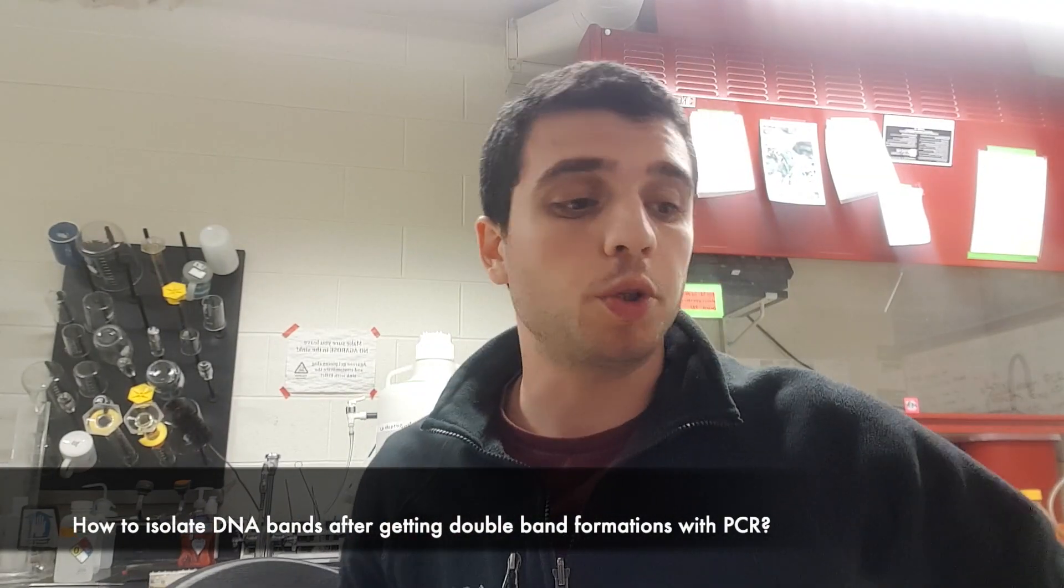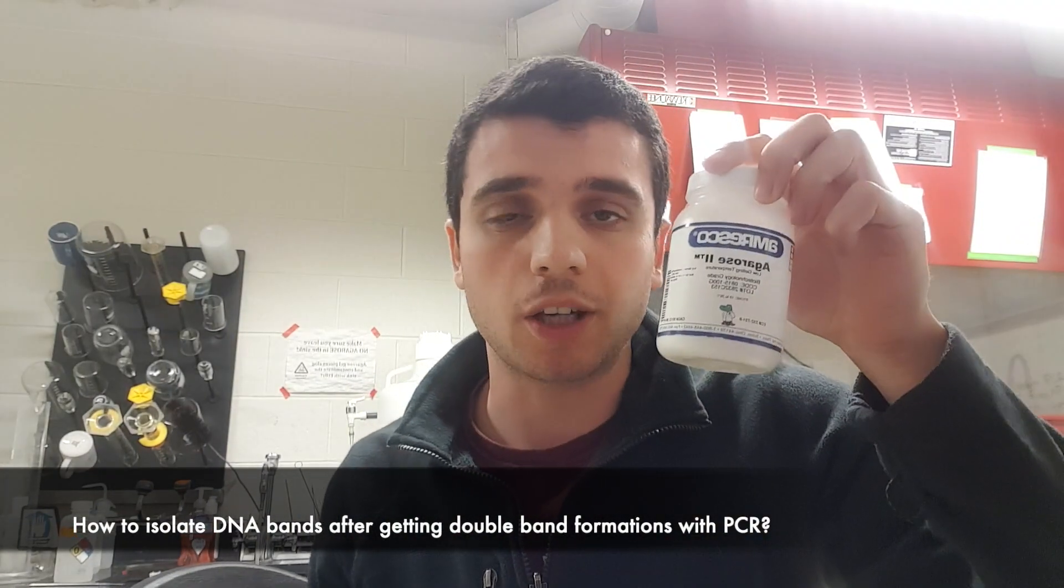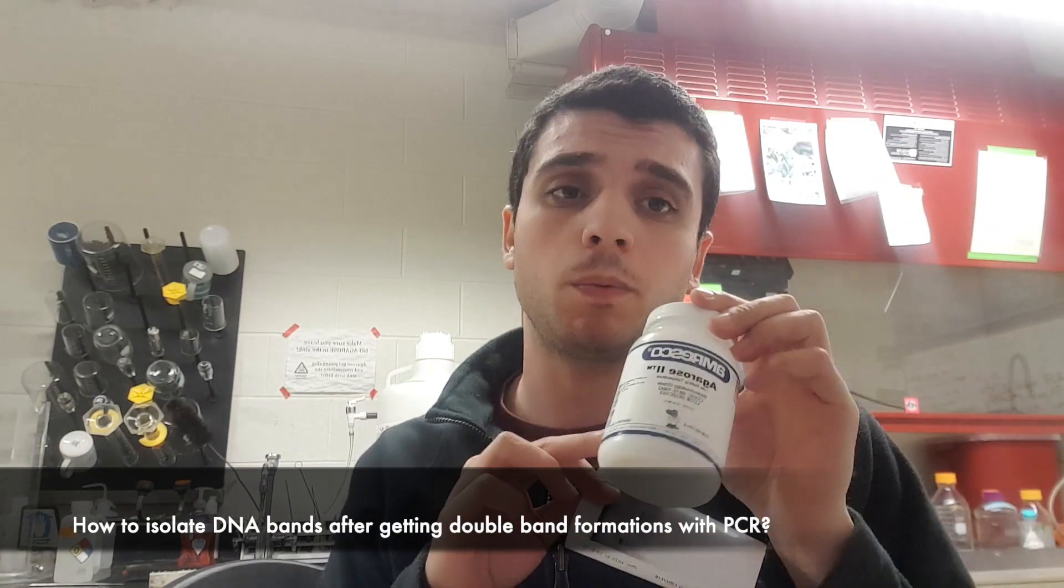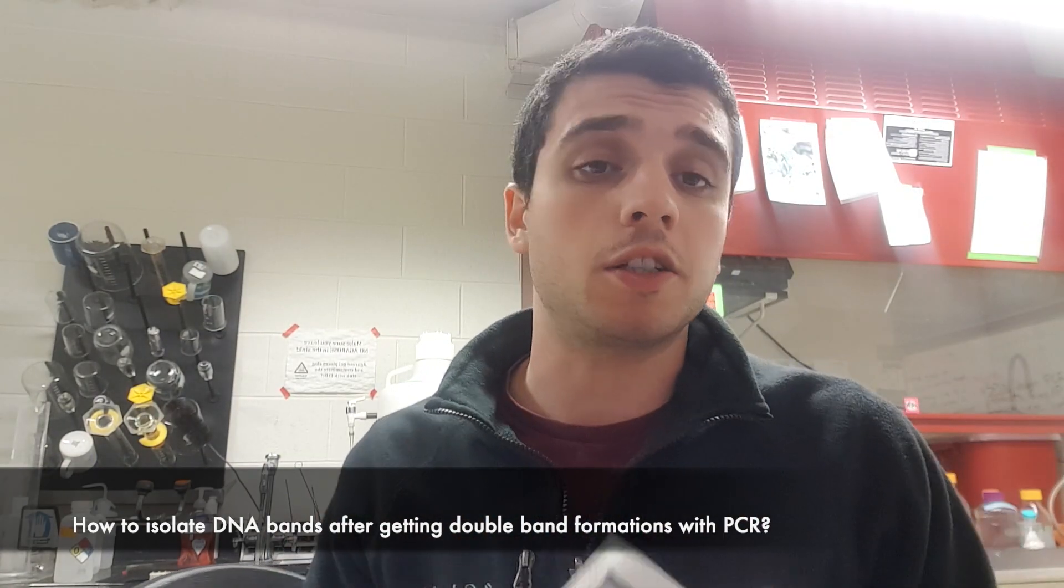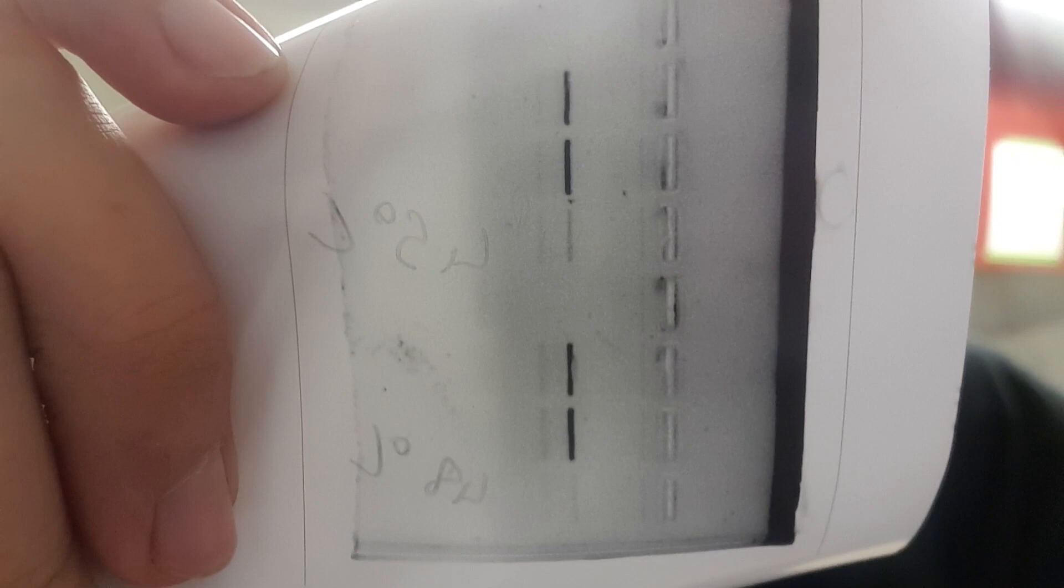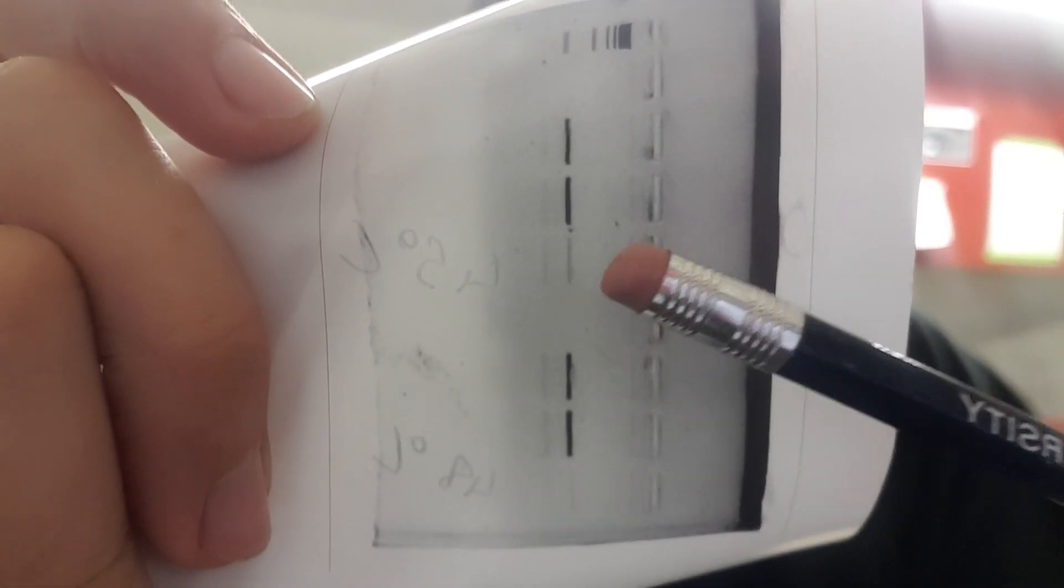Hi everyone, in this tutorial I will show you how to use low gelling temperature agarose. The reason why we need to use this is because I just performed a PCR and one of the results I got has two bands right next to each other and I need to isolate the one that's right here. To do that I have to use low gelling temperature agarose.